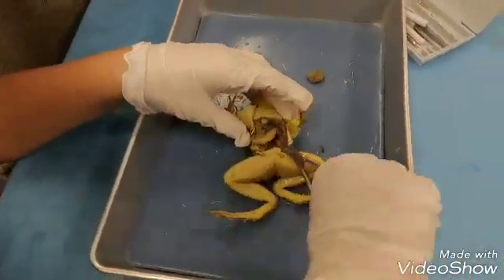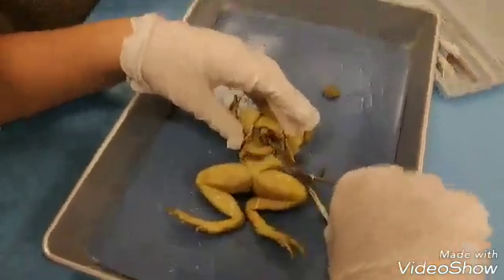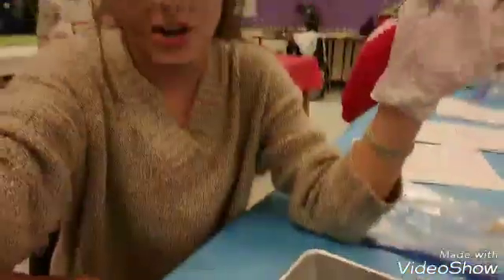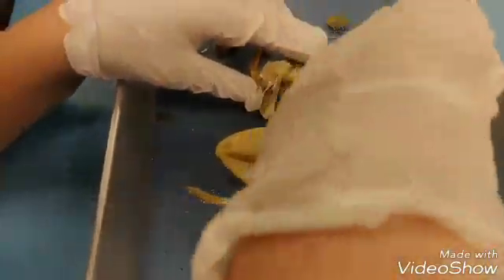I'm going to get it at a good angle. Okay, I have to film this. Is this the liver? Yeah. I'm so sorry about this. That video's gonna be demonetized.